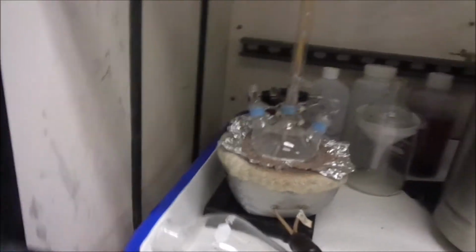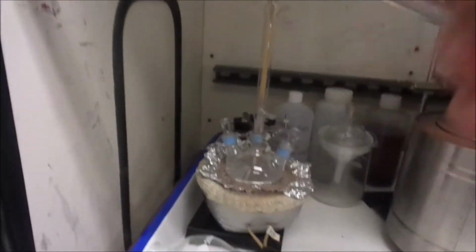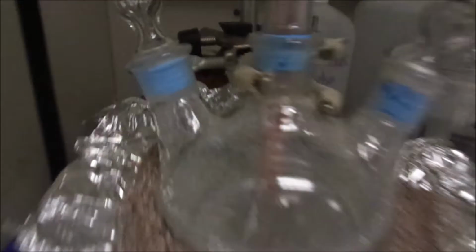All right, so it's getting up to temperature. It's right around 186. That's where it starts to boil under vacuum. We can see it's just starting to come up the column here. It's got a long way to go. It is pretty tight inside that space. Because the thermometer goes down through the center, that tube's not all that big. So I don't know if that's going to be a problem or not.